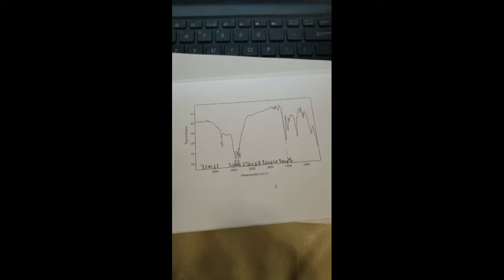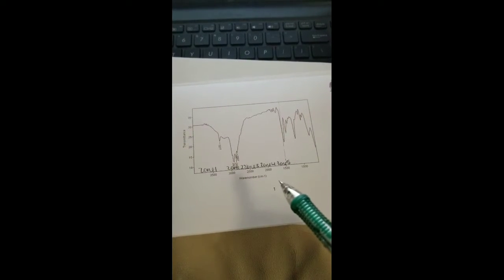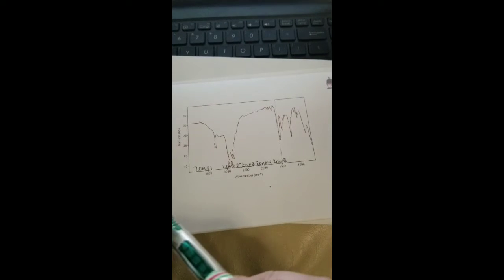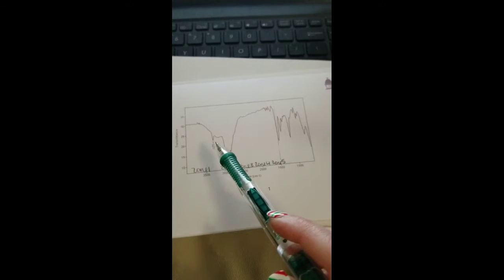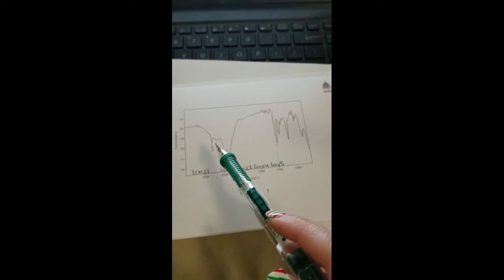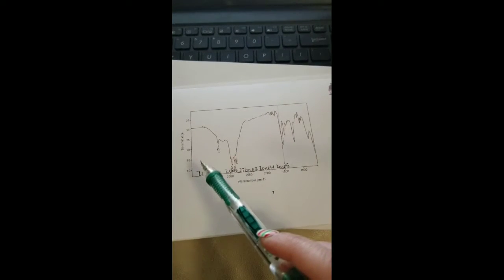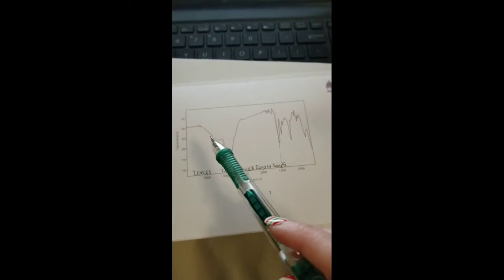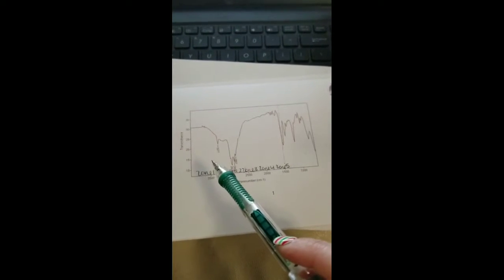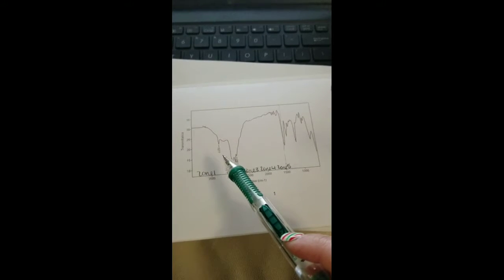We're going to look at IR. In this chart, there are 5 specific zones that we will look at to determine what we will find in our structure. We work from left to right because it's easiest. In zone 1, we've got this little blip here, which determines that there is a secondary amine in this compound. There's no dip for an alcohol, which we know because we don't have any oxygen in our compound. But it's nice to keep an eye out for. So no OH in this, but there is an amine.